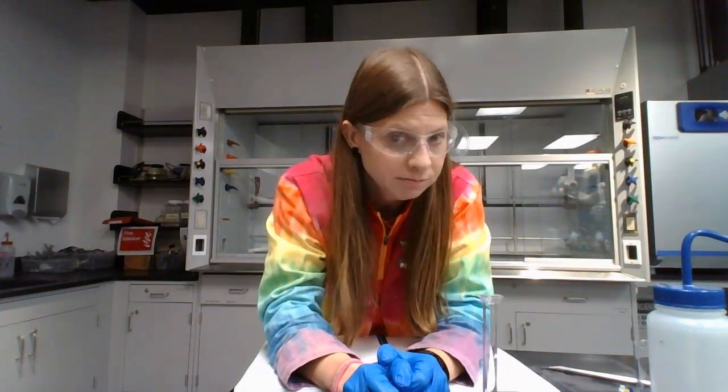So a lot of this lab is waiting for your turn with the NMR. That's okay. It'll be good times. Half the class will be doing this lab and half the class will be doing a different lab. So your lab table will all be working on this NMR lab at the same time, and the other lab table will be working on a different lab.